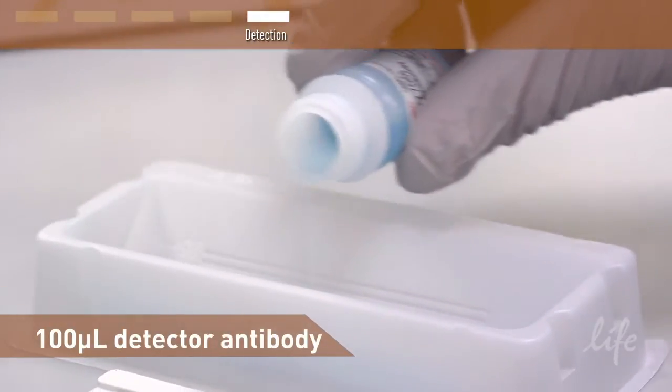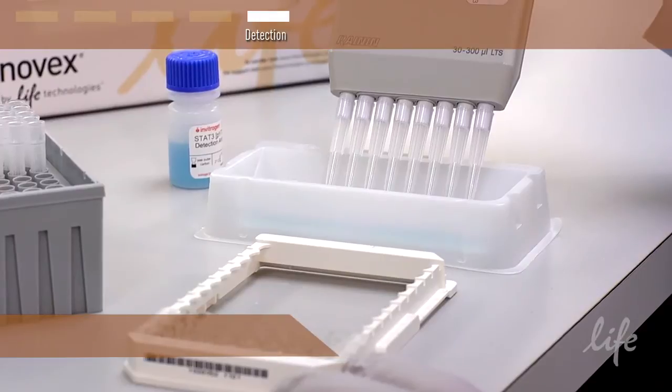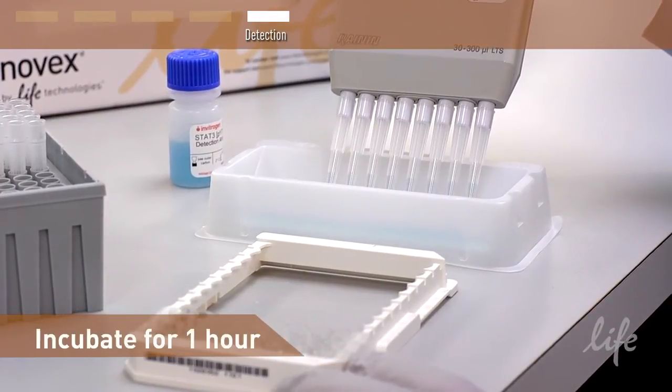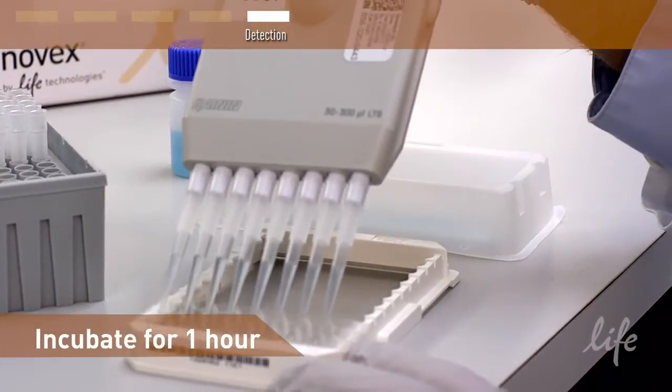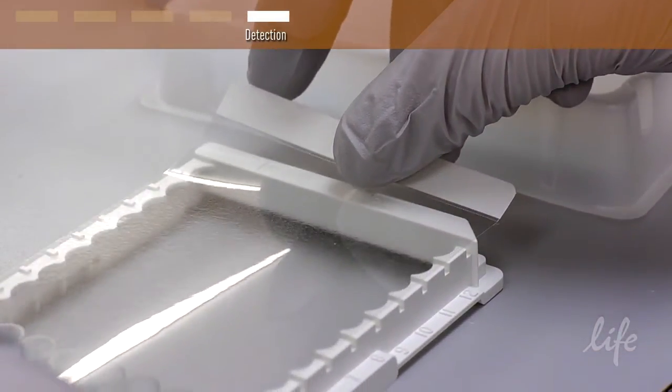Prepare the detector as recommended in the technical data sheet by diluting the detection antibody in assay buffer. Then add 100 microliters of the detector antibody to each well containing sample or standard. Incubate the detector antibody for 1 hour.